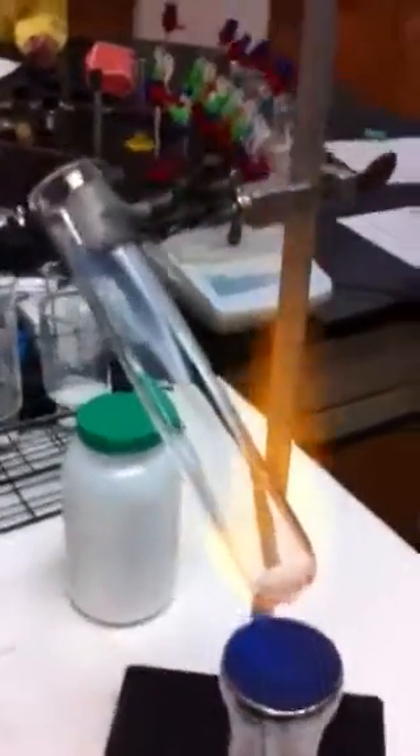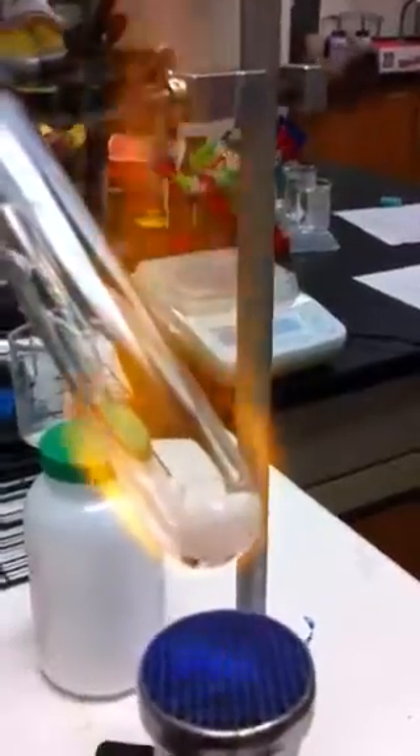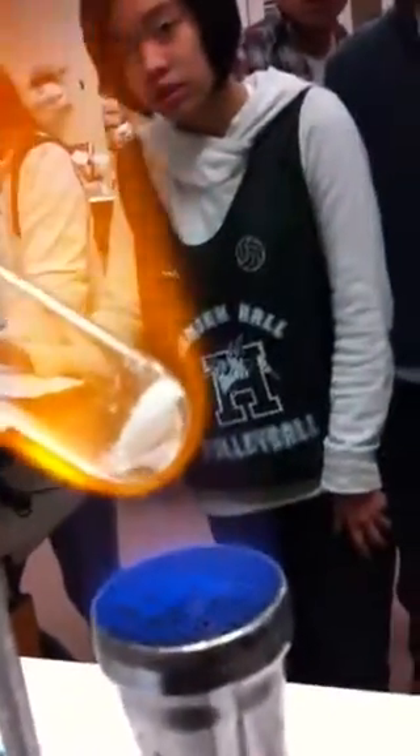What's happening? Somebody tell me — liquid is forming. What do we start with? Salt. And what do we have now? Can we tell it's melting? What do we see while it's melted?